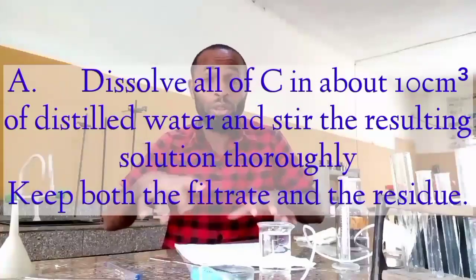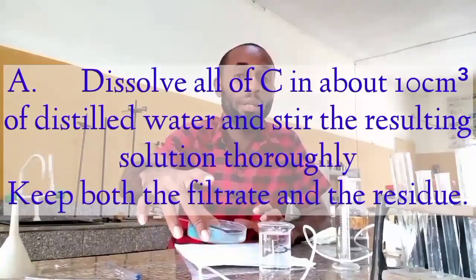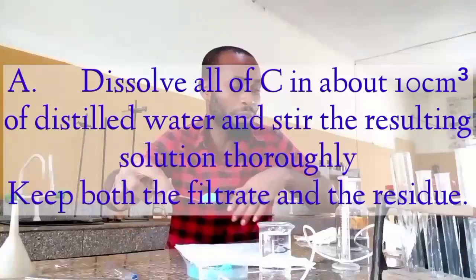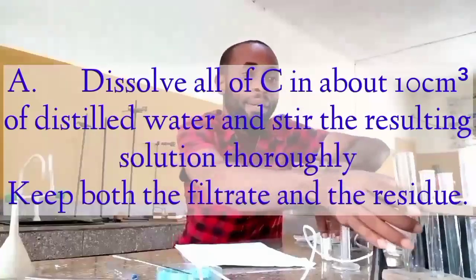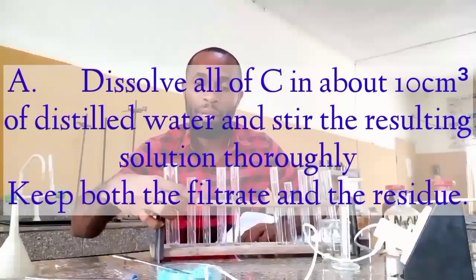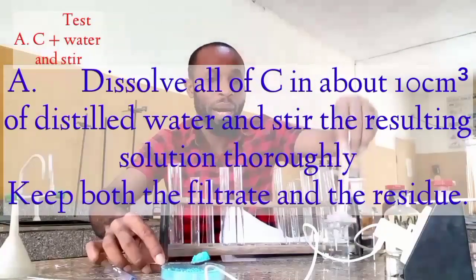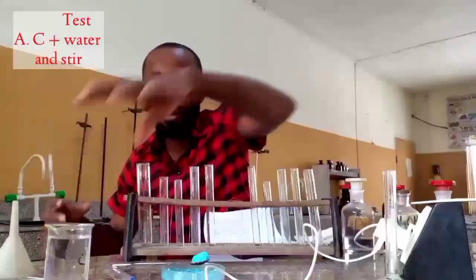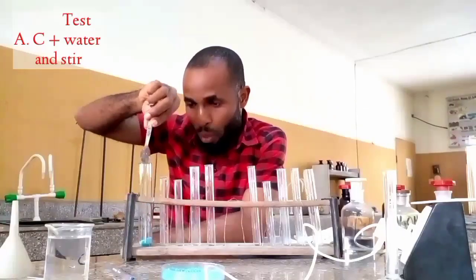Therefore, despite the instruction that I should dissolve all, I'm not going to dissolve all, because there's something I am expecting to see at the end of this qualitative analysis. So let me just make use of only one full of this. I'm going to put it into my test tube. Let me bring in my test tube rack so you can watch what I am doing perfectly. Okay, this is my test tube rack. I want to make sure that you are seeing this perfectly. Remember that this is what I'm using for this work.